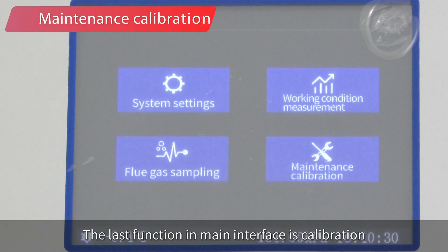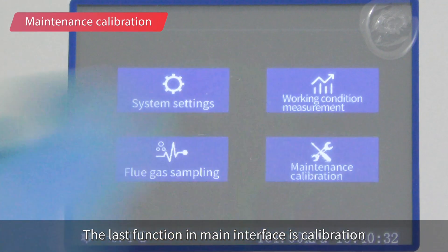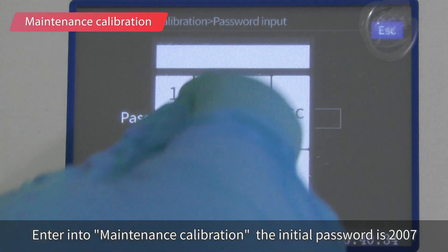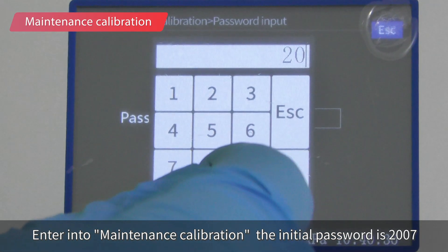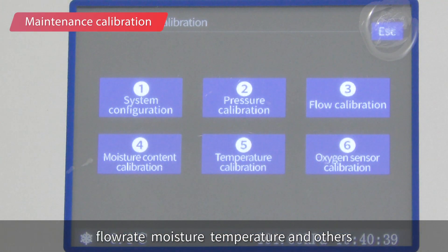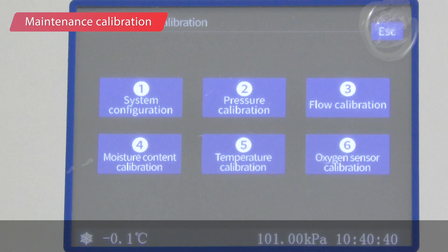The last function in the main interface is calibration. Enter maintenance calibration — the initial password is 2007. Here you can configure the system and calibrate pressure, flow rate, moisture, temperature, and other parameters.